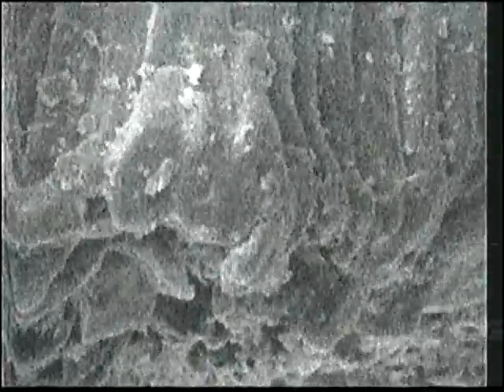And you can see that it has a husk, because the husk is flaking off here, just like a husk of a corn. And then the kind of neat thing is the stalk, where it was attached to the grass and where it broke off. I can make that brighter by changing the condenser lens again. So I'm starting to kind of get a feel for this machine. It's starting to behave quite nicely, actually.